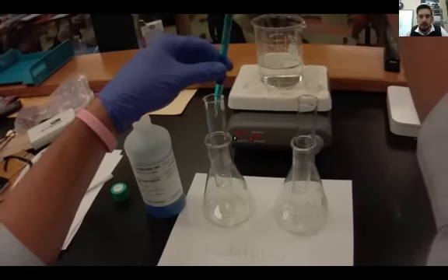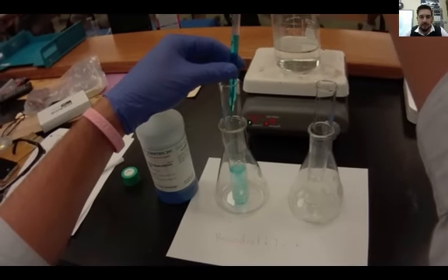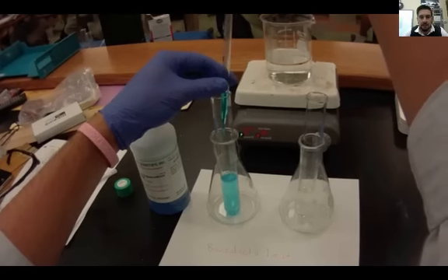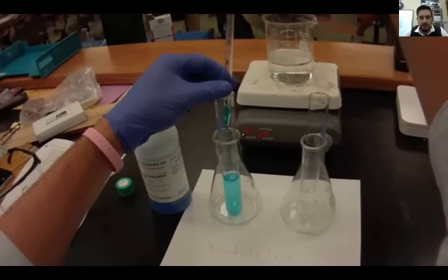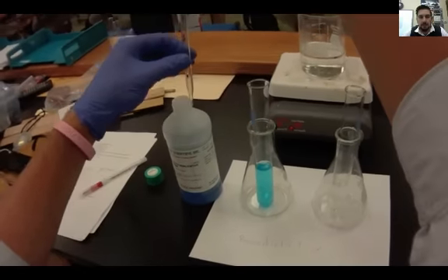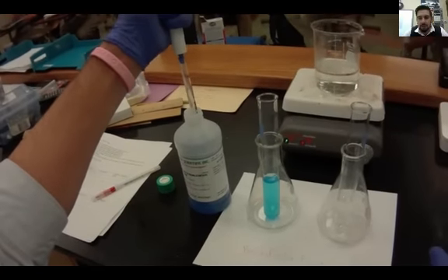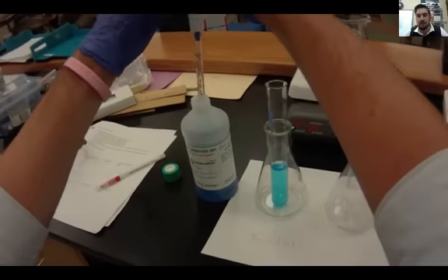I'm going to go ahead and dump it inside and to my solution. There it goes. Either way, one of these has monosaccharides in it and I'm going to find out.